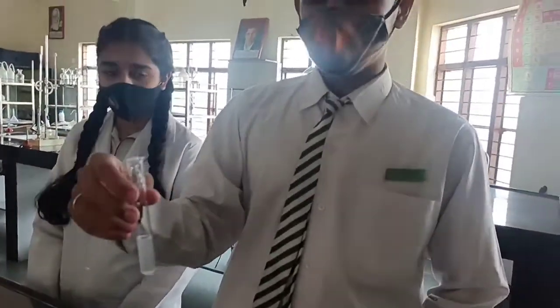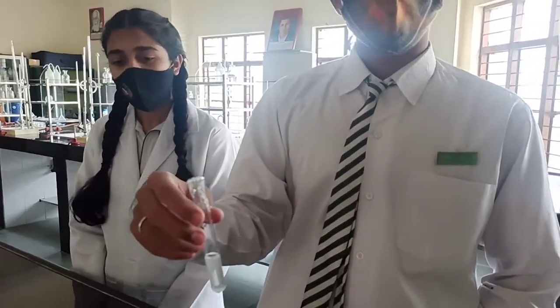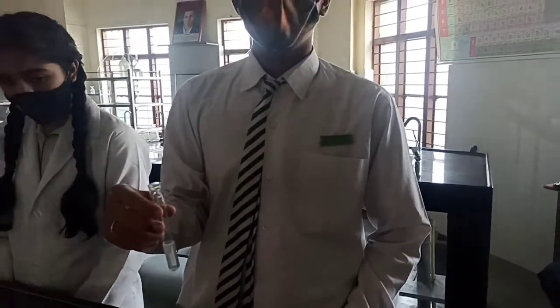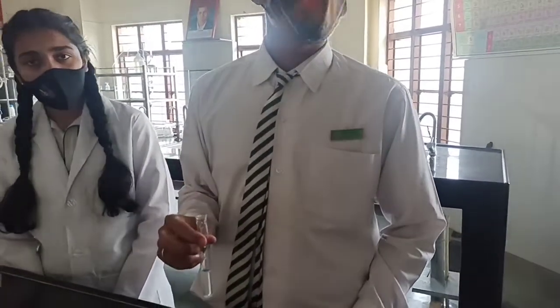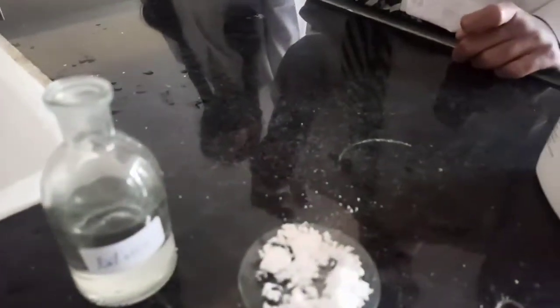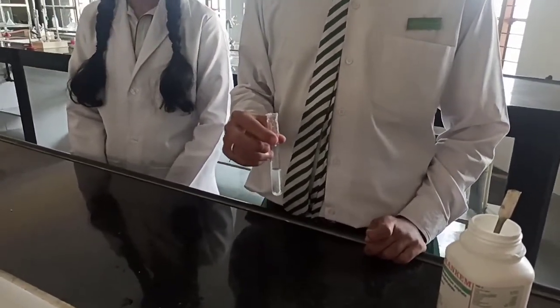So, he has got a solution of the salt. This is called the aqueous solution of the salt or original solution of the salt. Now, solubility for the physical examination is, we will say it is soluble in water. So, physical examination is done. The salt is colorless or white. The salt has a characteristic ammoniacal smell when we smell it. And the salt is soluble in water.